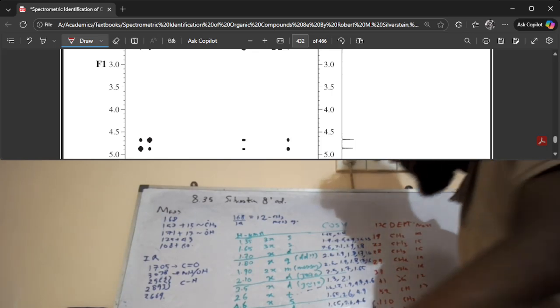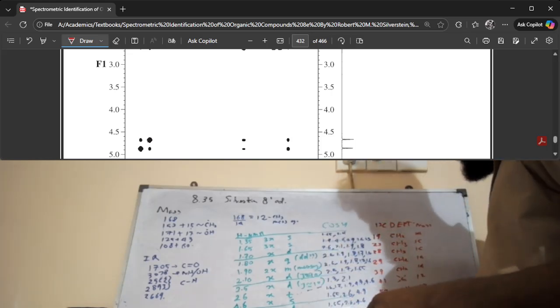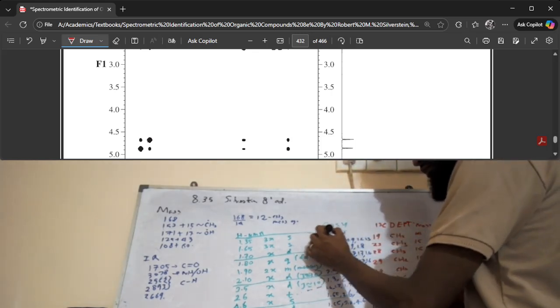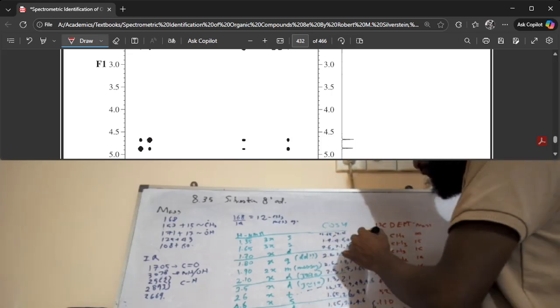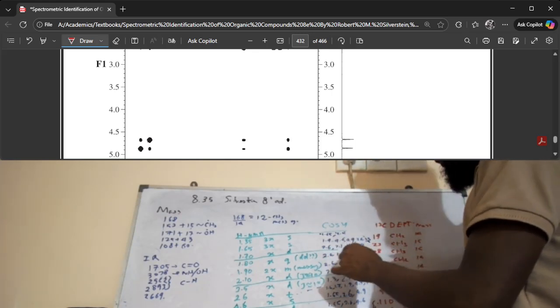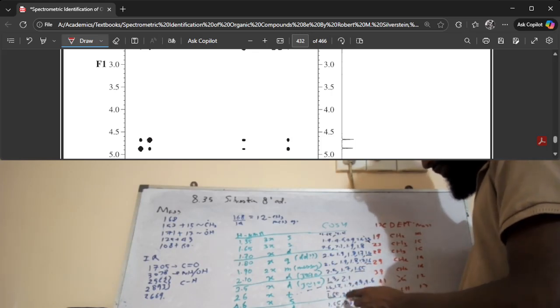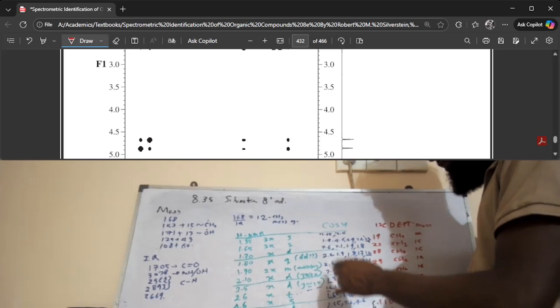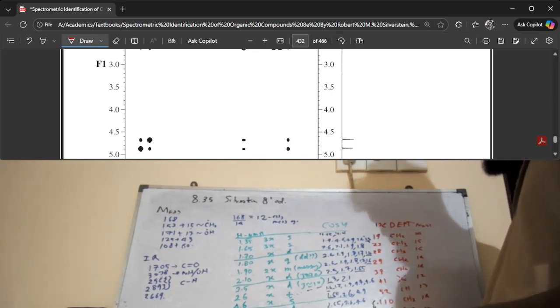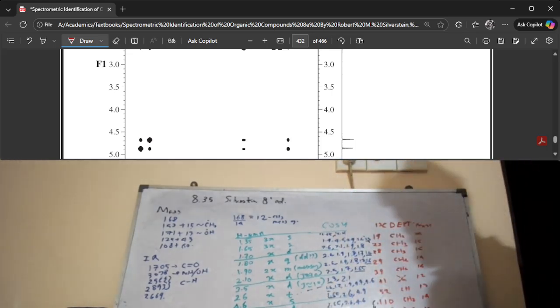So before we go anywhere, this just can't be right. It's a singlet, so we're going to ignore this. We are going to ignore the ones that I'm going to mark with a black dot. So this is ignored. The 1.6 everywhere they have the 1.3, we're going to ignore it. Because that's disorienting, right? You can't have a CH3 singlet having this many correlations. So these are going to get ignored. We're going to work with the remaining ones because sometimes COSY spectra can give noise, so unexpected observations, which we should know what to ignore and what to keep in mind.